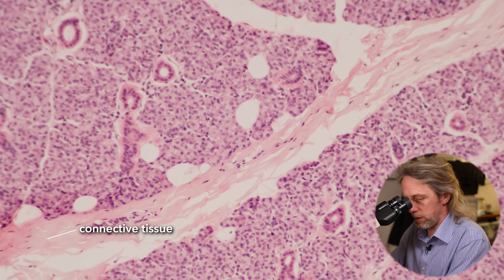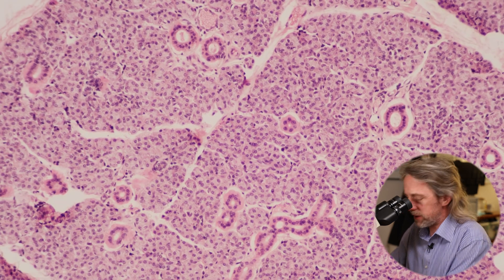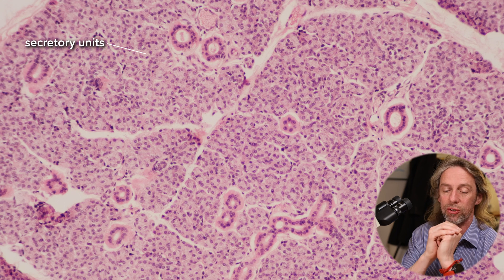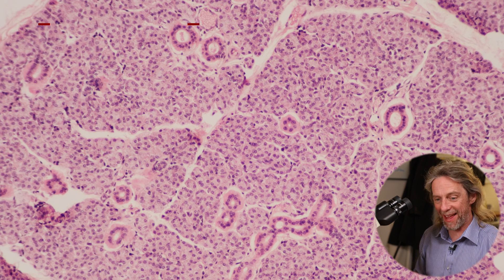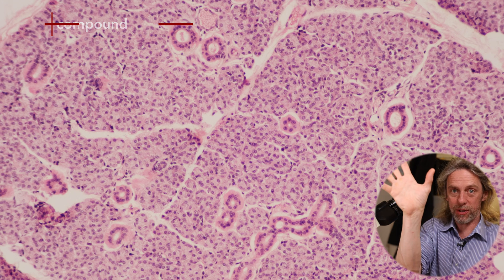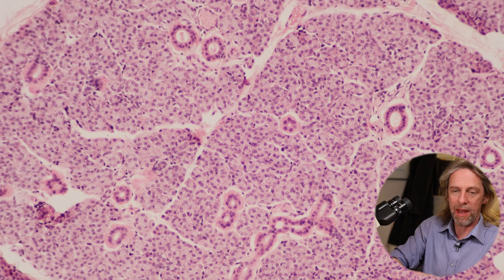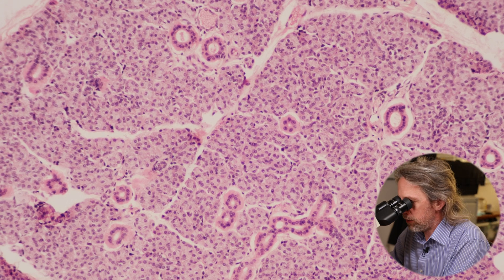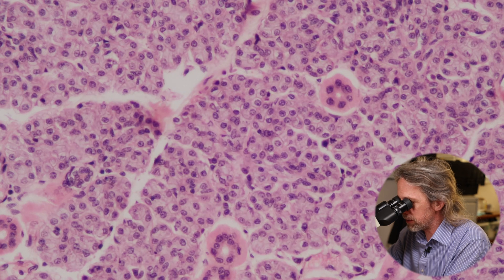There's the connective tissue running between the lobules — that's the organization. What we've actually got is lots and lots of circles of cells, not the tubes but all the other cells arranged into circles. This is a compound tubulo-acinar exocrine gland: compound means it has branching ducts, tubular means we've got tubular sections with secretory cells arranged around them, and those tubular sections end in a curved acinar portion. So we have acinar cells.